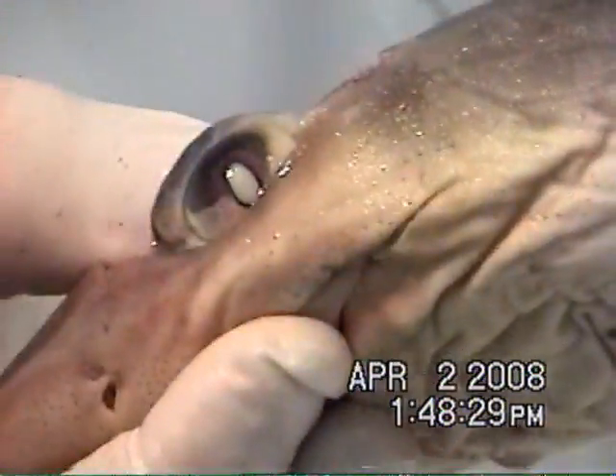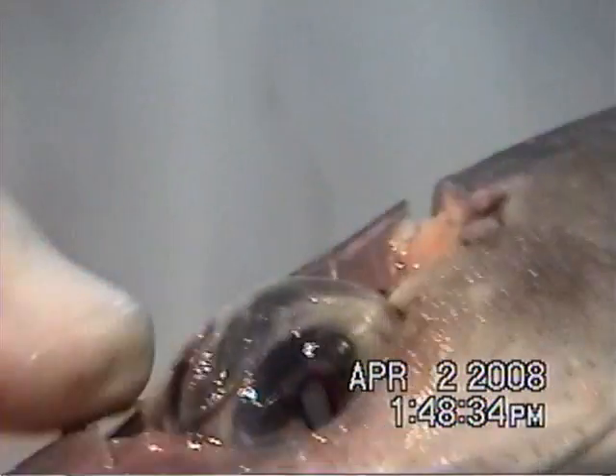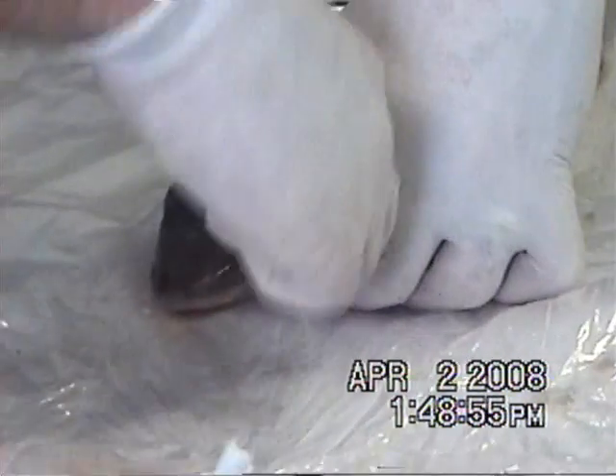The eye is almost completely separated from the cartilage. There are about three muscles that control eye movement, so what I'm trying to do is get those muscles cut so the eyeball will come out. Right now, the good news is I have not punctured the eyeball.